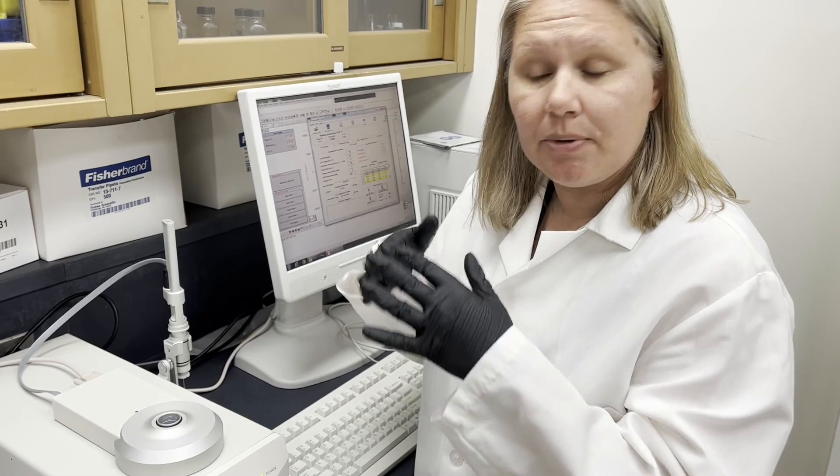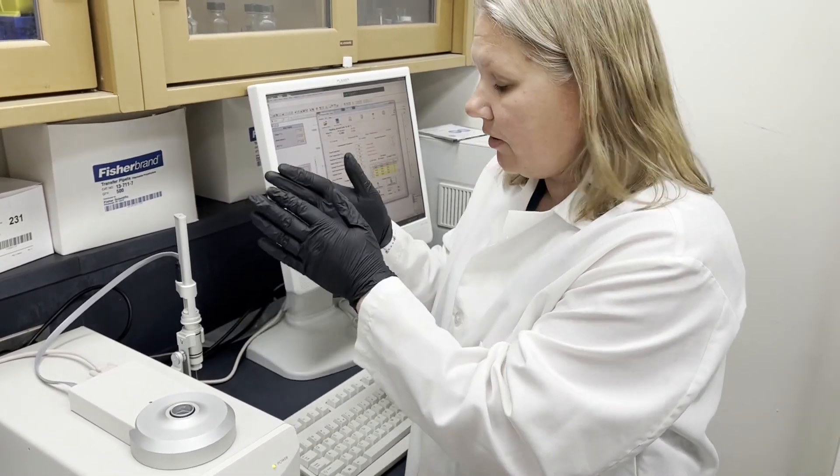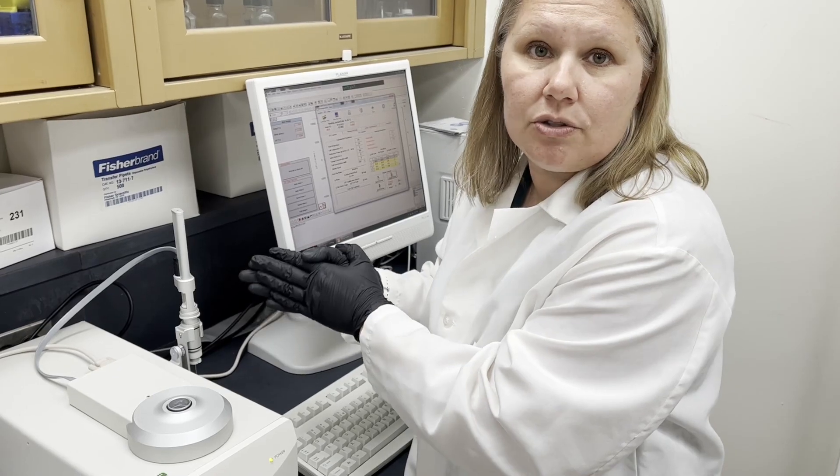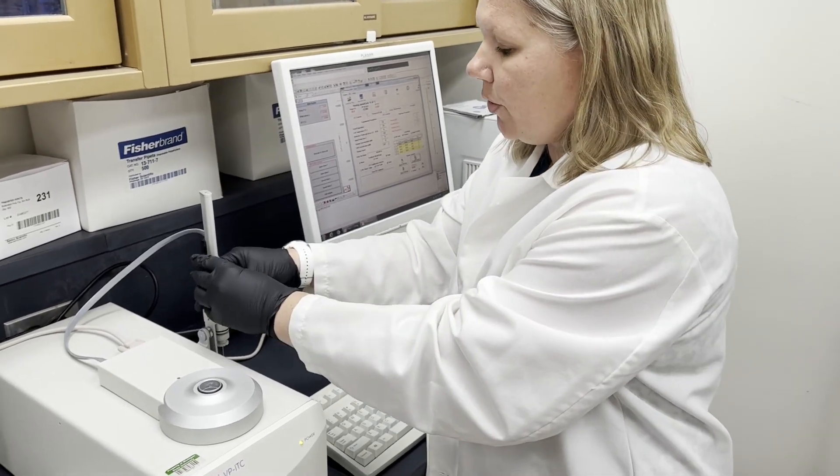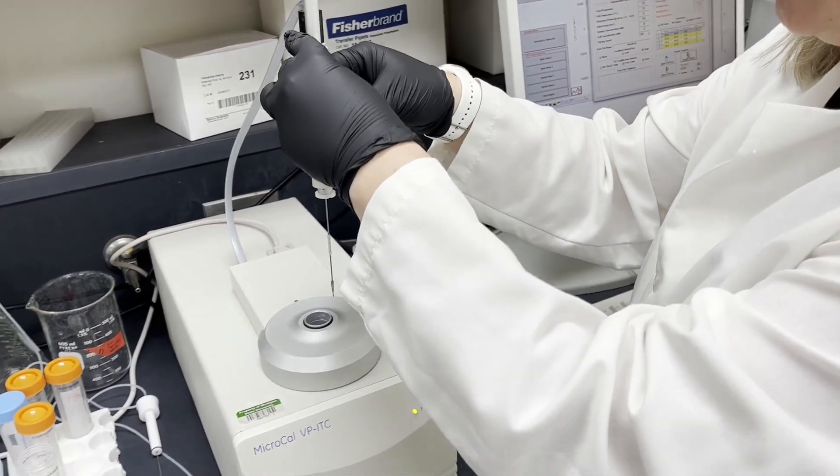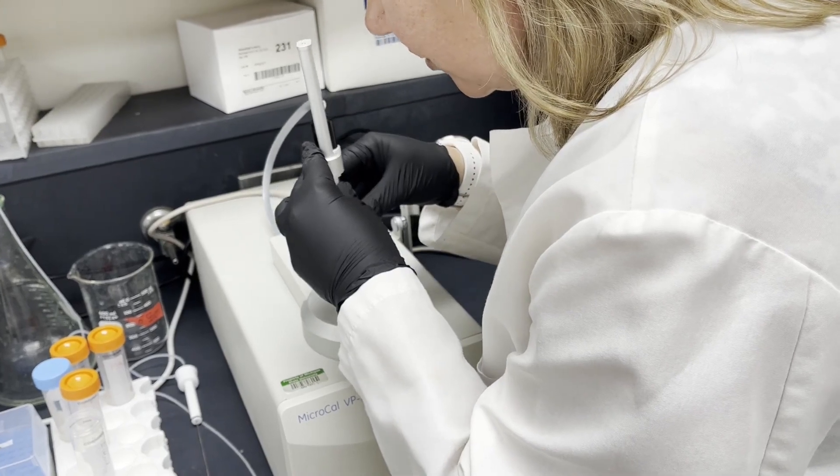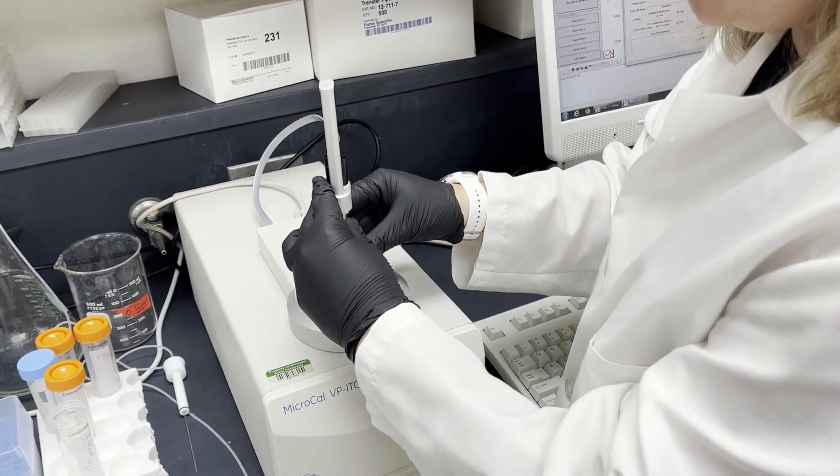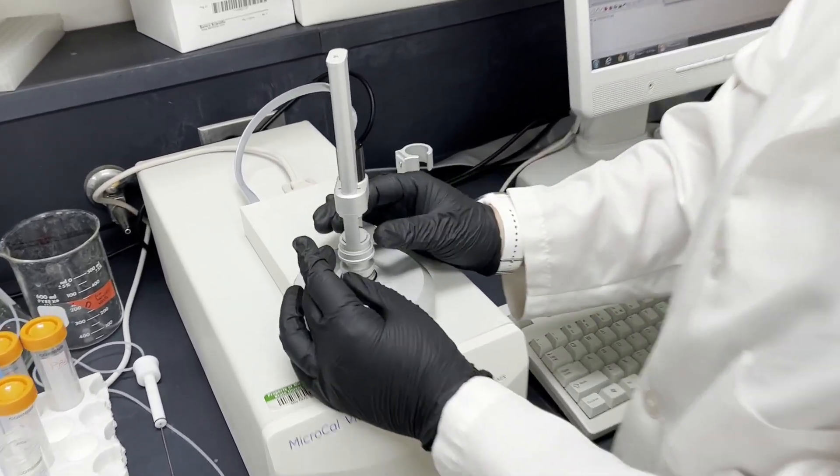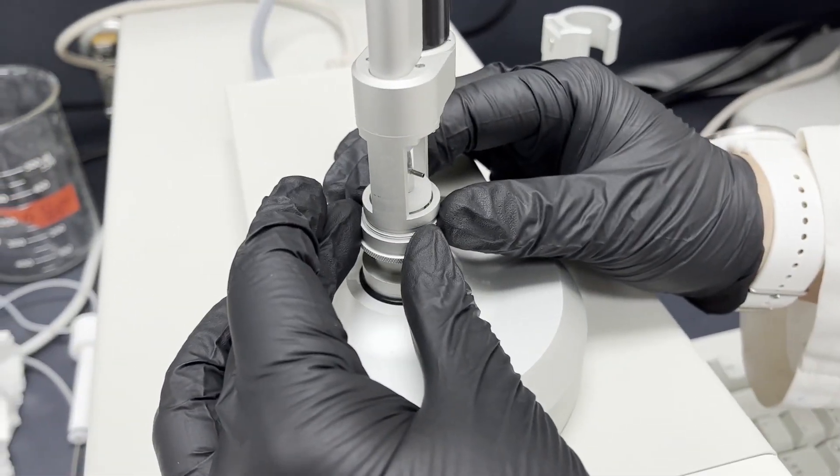Now that your sample is loaded into the sample cell and you have your ligands loaded into the injection syringe, you're going to physically lift up the injection syringe and put the syringe into the sample cell. What you want to make sure is that you put it in and then you hear it click down.